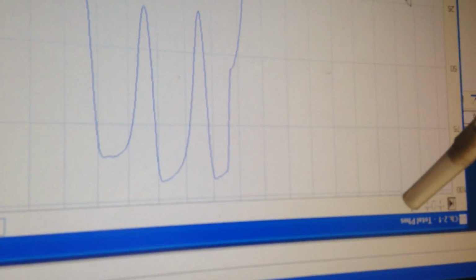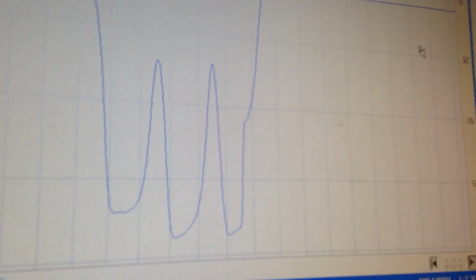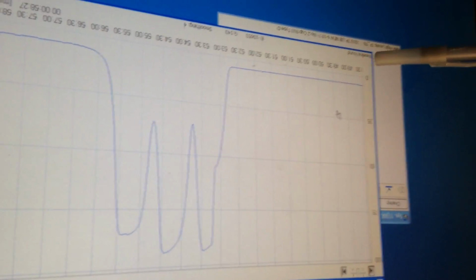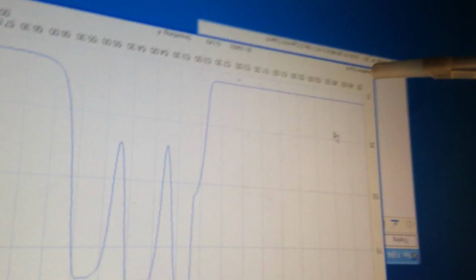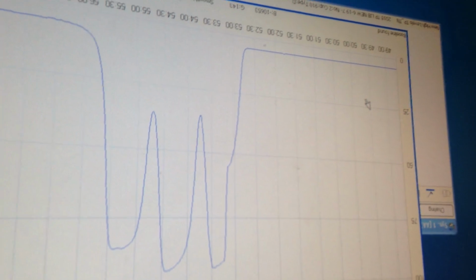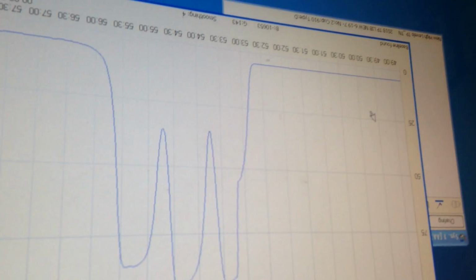And you'll see it again once it does the calibration. You'll see another button up there that you can bring up your calibration curve for the day and see the regression. And you also see the correlation coefficient down here versus baseline found. But the next thing you'll see is primer found or primer not recognized. That's the other thing. And if it says primer not recognized, it's still going to sample everything, but you're not going to have any values to go with it. So you need to stop the run at that point and start over. But right now, we can pretty much walk away.